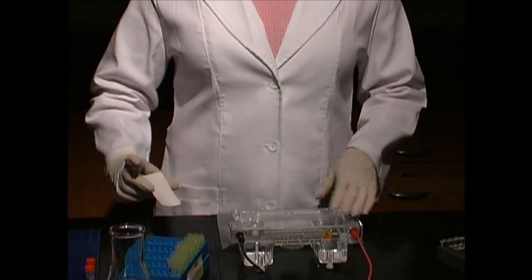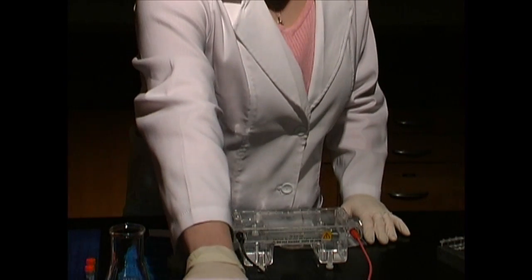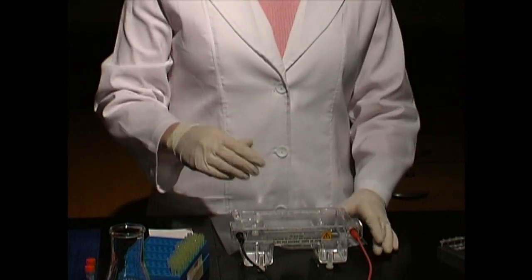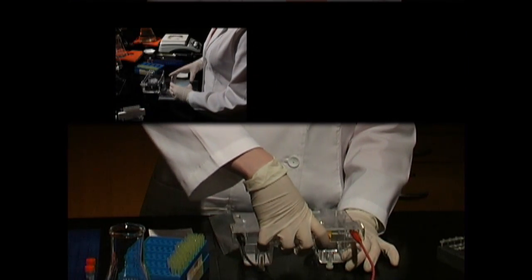Once the electrophoresis is done, turn off the power, unplug the electrodes, and remove the cover.